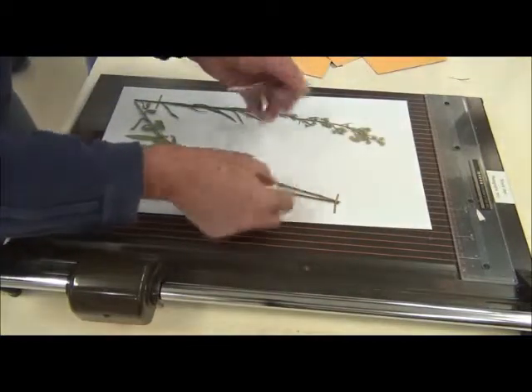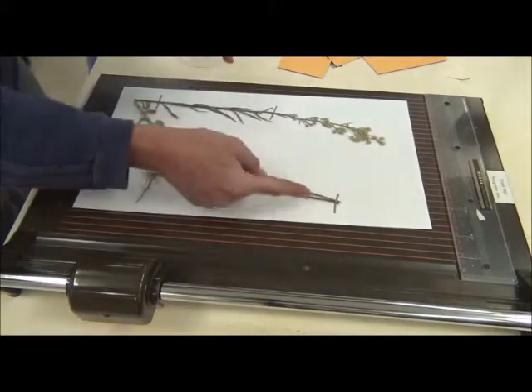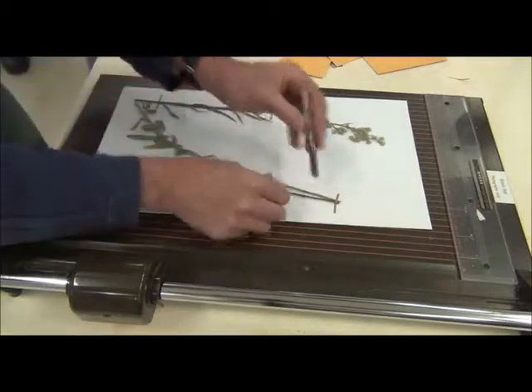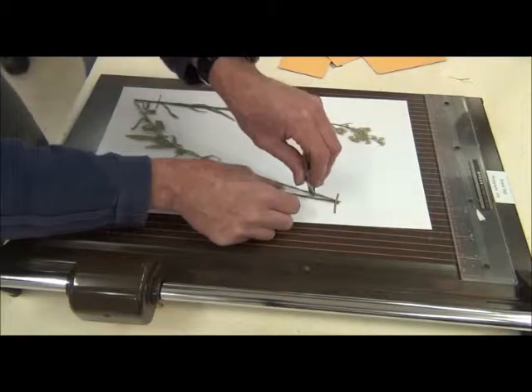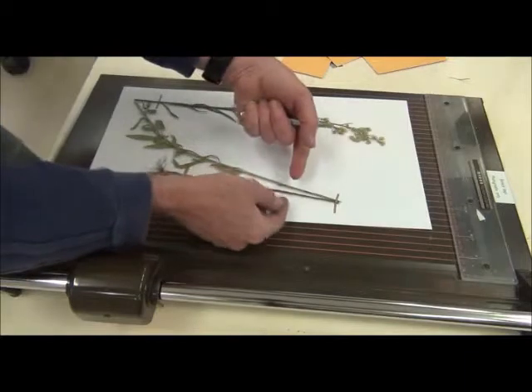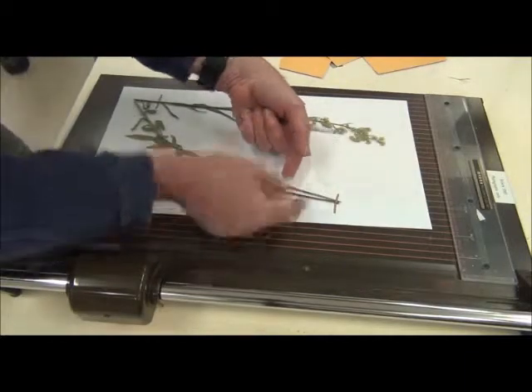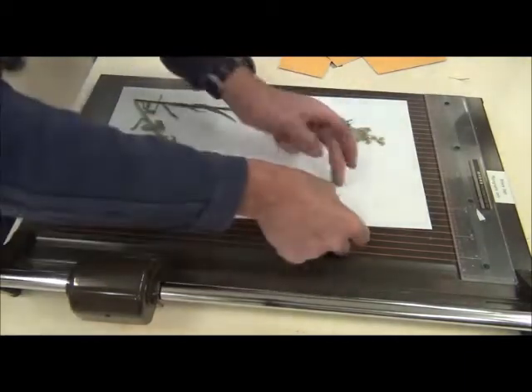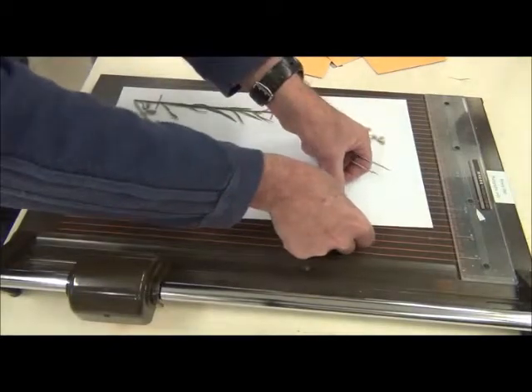If I come down here, I either have to go down, up, down, up, down. And make sure I use the forceps to push that down in between. Or, I slip it under one and just tie one. Okay? I just went for the line of least resistance here.